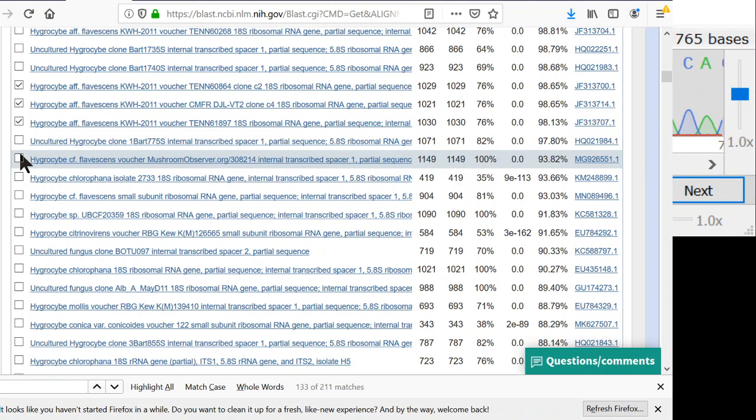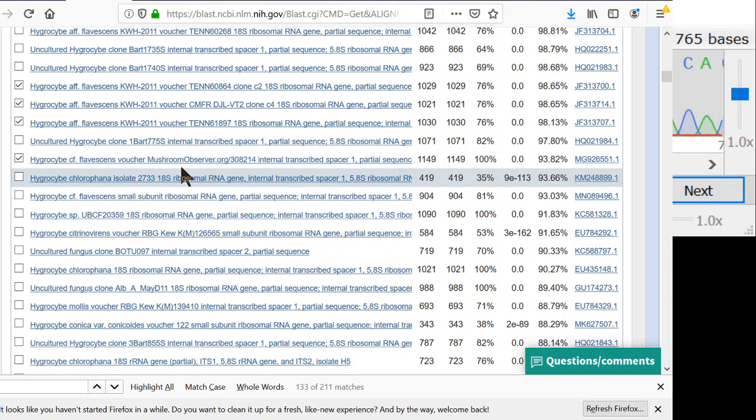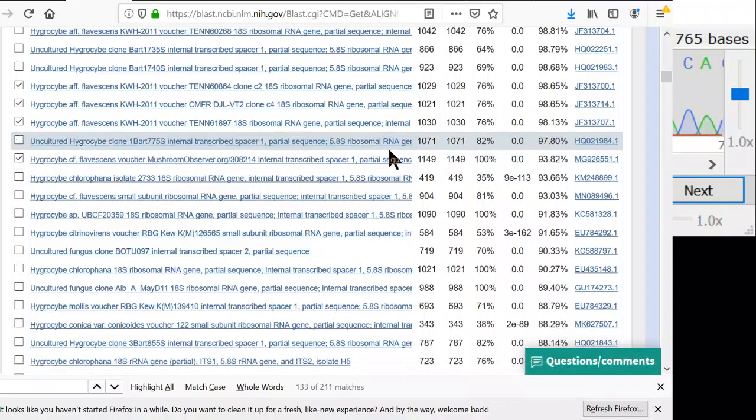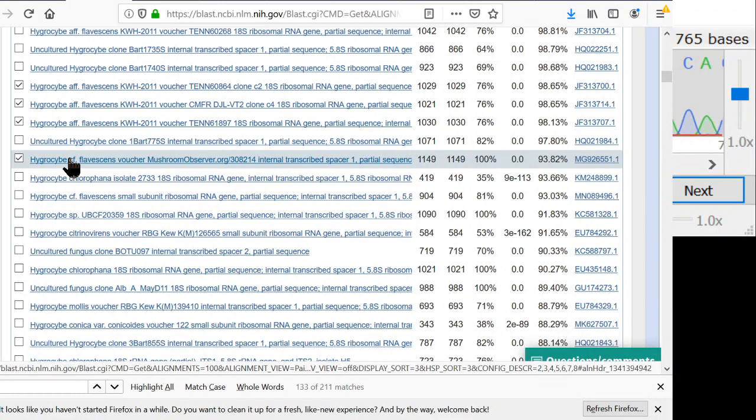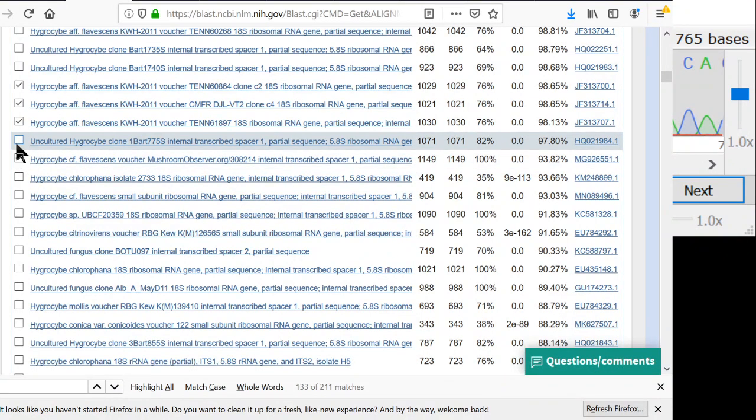Here's my sequence from California. You can see my sequence from California is also going under the name flavescens, but it only matches 93%. So 93% is very far, and that means that these are not the same species. And that's why I put the CF in there. The CF means confer to, which means that I'm going to use the name Hygrocybe flavescens because I know that there is no name that matches better, because the one that I found in California is an undescribed species. It has no scientific name yet. But I definitely want it in my tree. So I selected that one. This is probably a different Hygrocybe over here. We'll select this one.